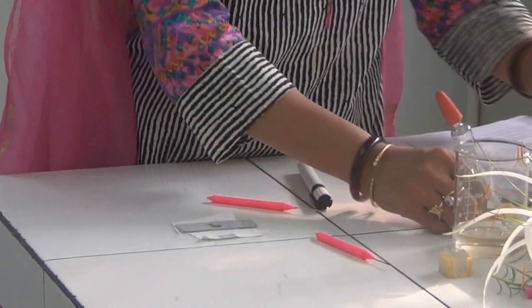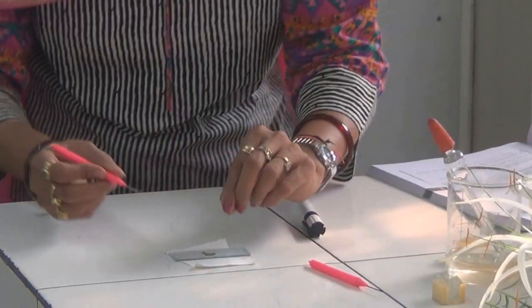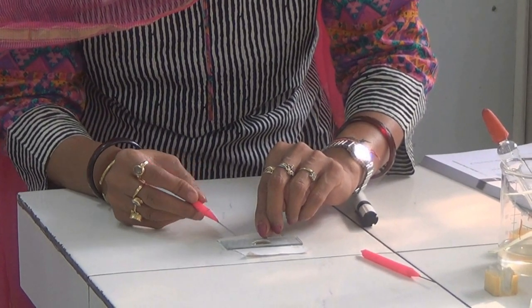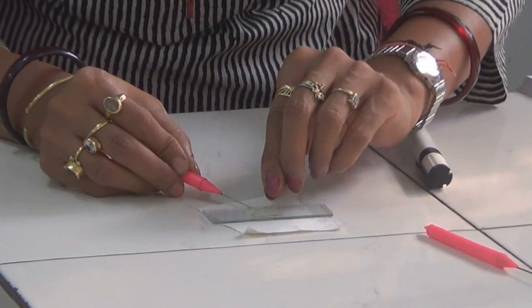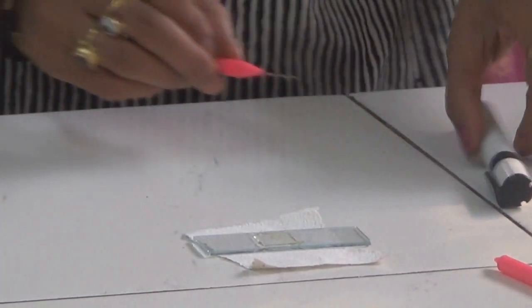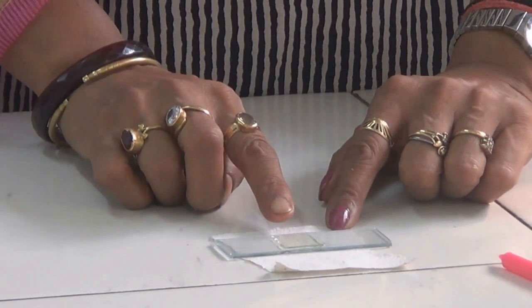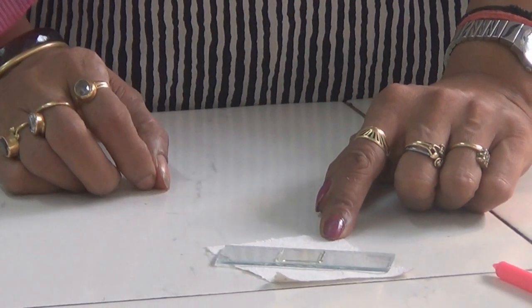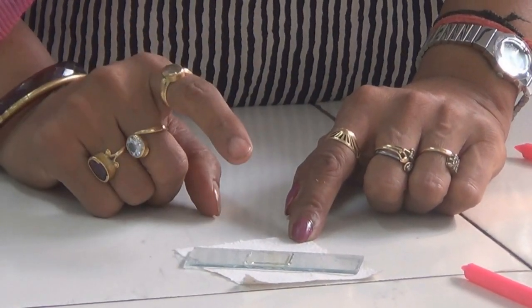Then, with the help of a cover slip, we will cover the cavity. Take care that there should be no air bubbles at the time of placing the cover slip. Now, the pollens are in the nutrient medium and we have to keep them aside for about half an hour to observe the germination of pollen.